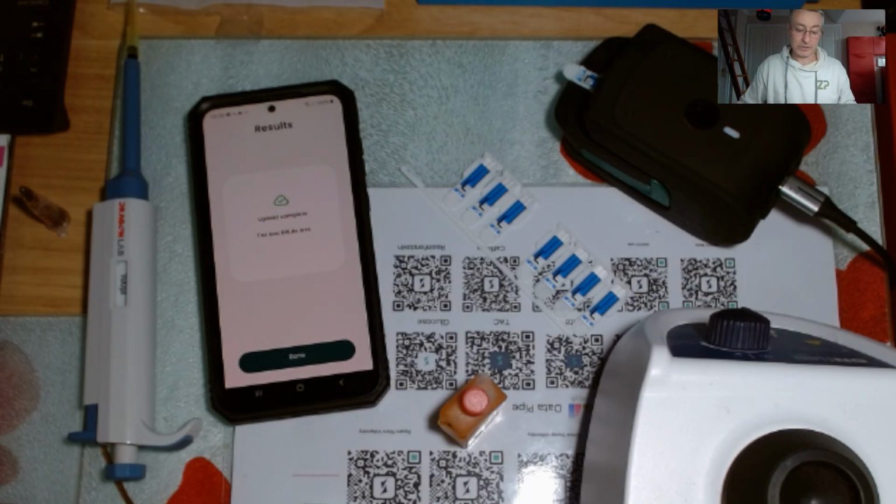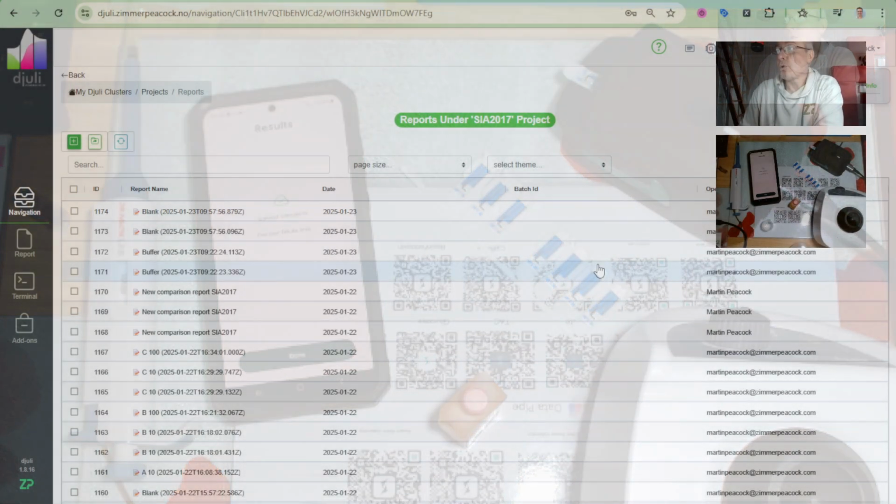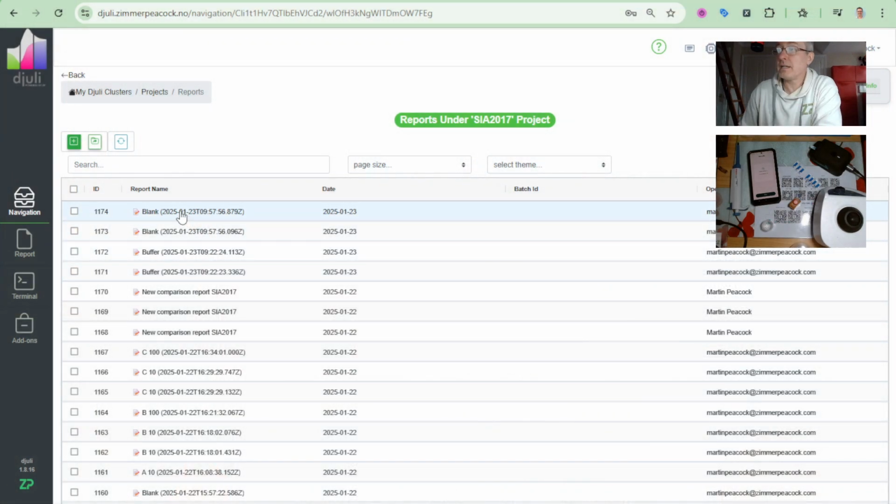Now let me stop for a second, because I just want to go to Djuli, which I realize I've logged myself out of, but give me a second while I log myself back into it. I'm just logging back in now. I'll share my screen with you. So I call that sample blank. And it's giving me this error, and the error again is upload complete, too low, dilute less.